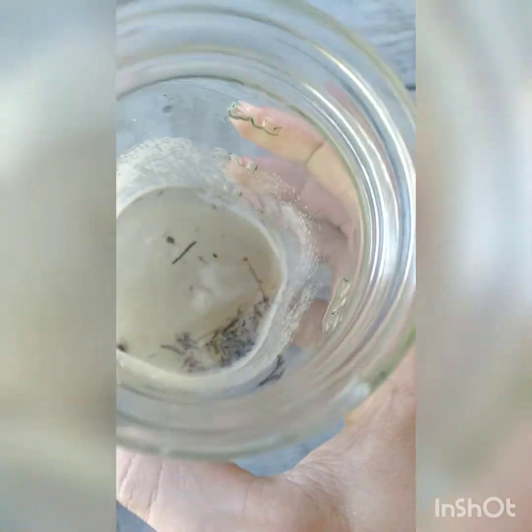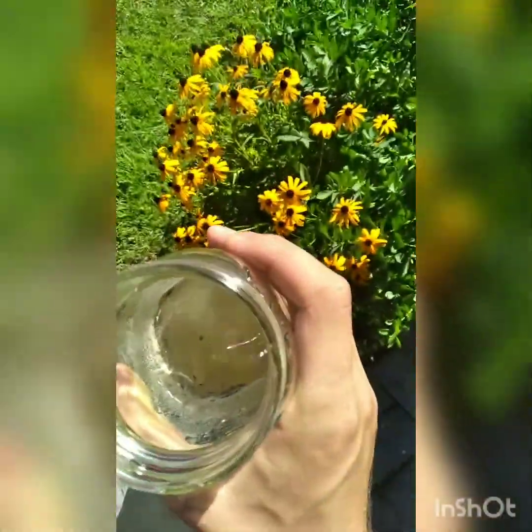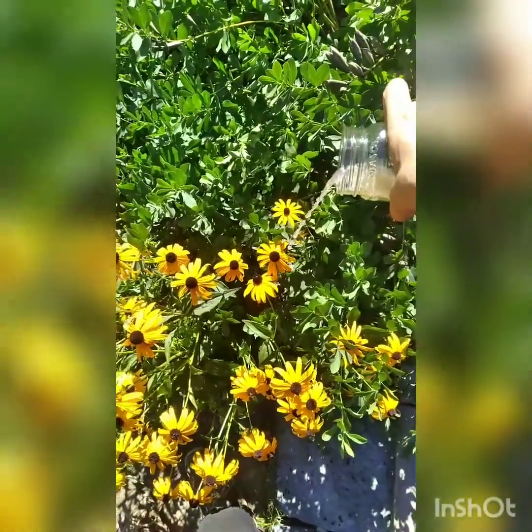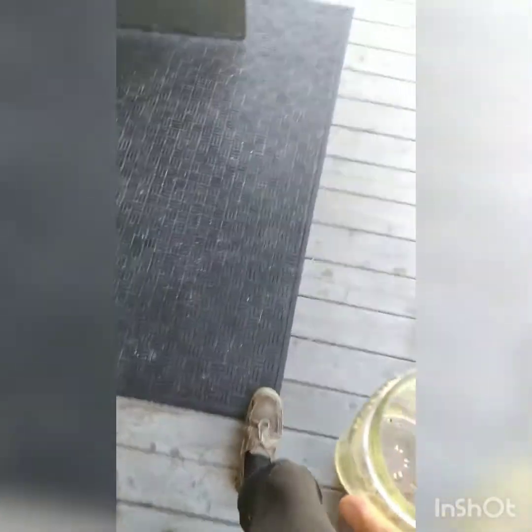You can see the bubbles, and hopefully spores are sticking on the sides there. So now I'm going to pour it off. The stuff that poured off is still probably valuable inoculant, so I'm going to go ahead and pour it on some plants. I hopefully will get some cool photos of the spores that I found here. Now I'm going to add a little more water, wash it out, put a handheld microscope into the solution, and hopefully I'll get some cool photos to show you guys.